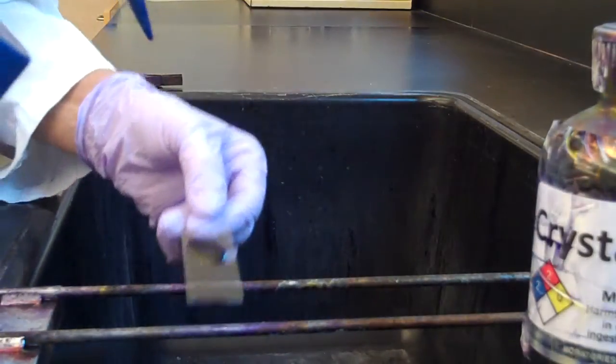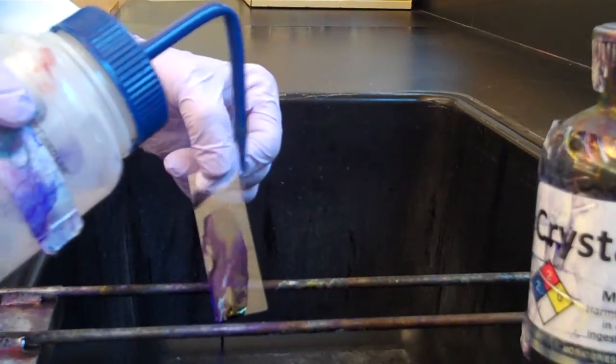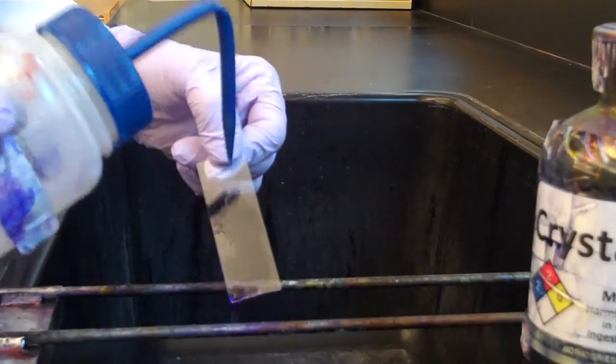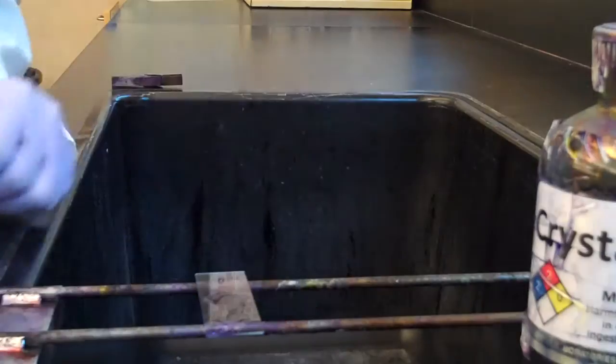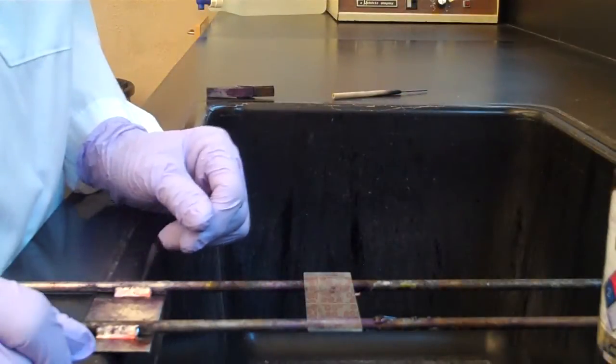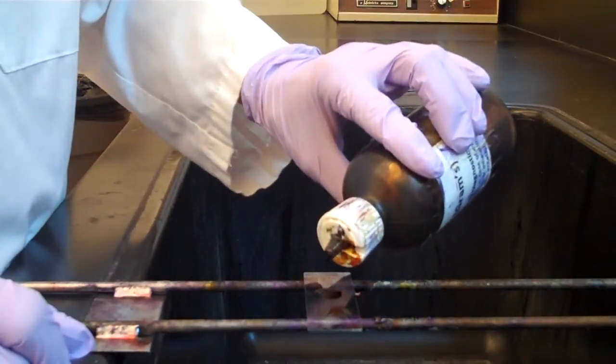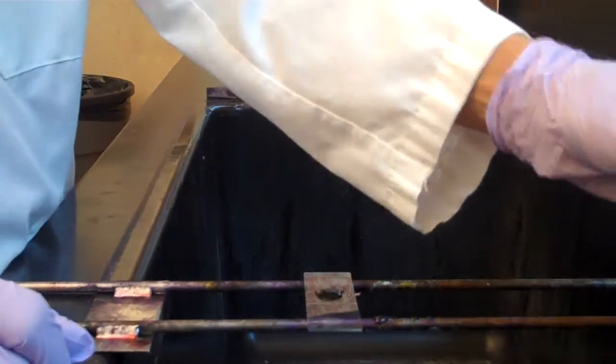Rinse the smear with deionized water and shake excess water from the slide. Put a puddle of iodine onto the smear. Wait one minute.